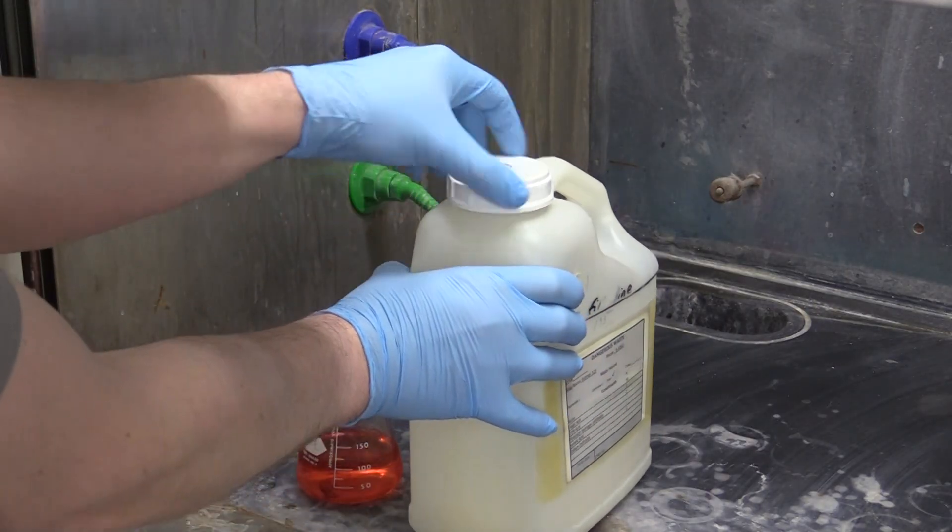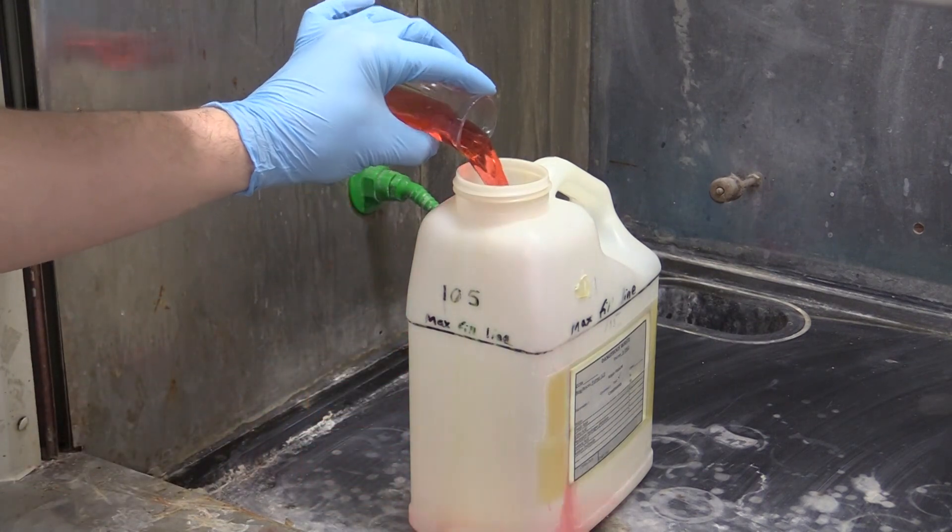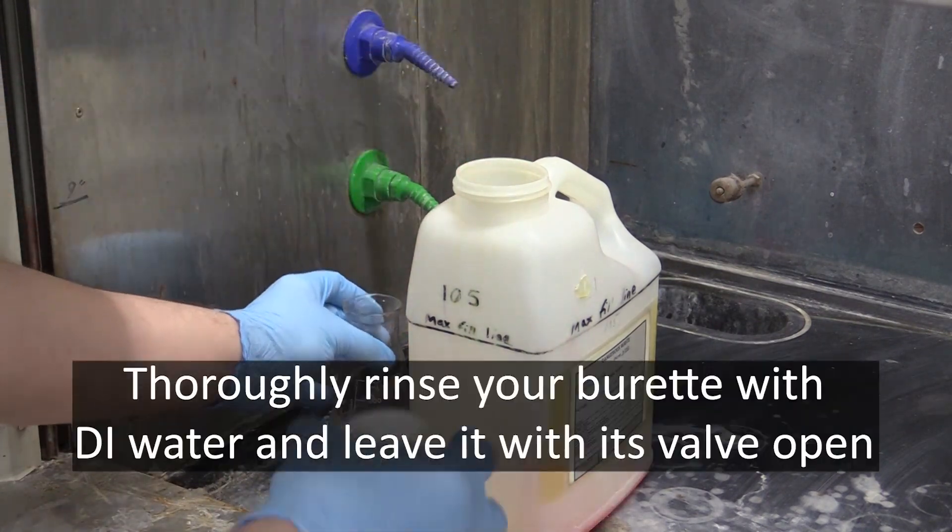When you are done, dispose of all solutions in the waste container in the hood and rinse your glassware with DI water. After you have rinsed the burette out, leave it with its valve open.